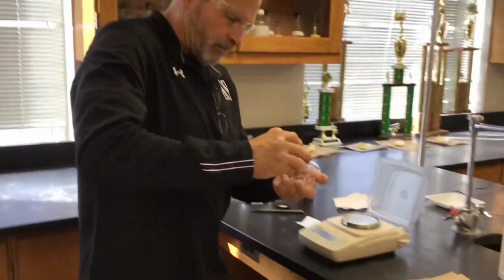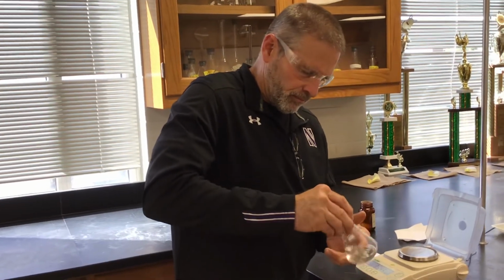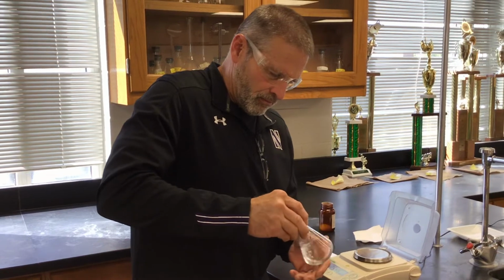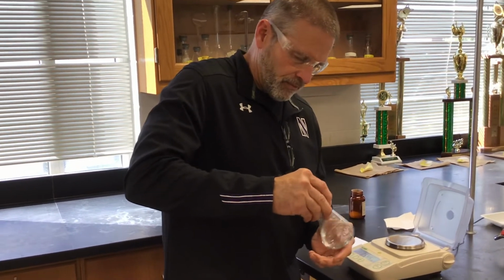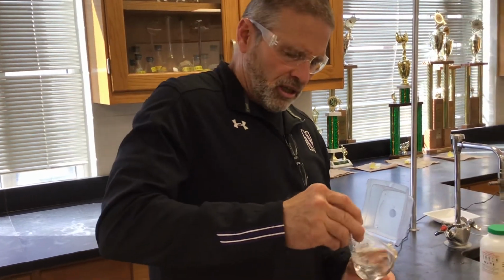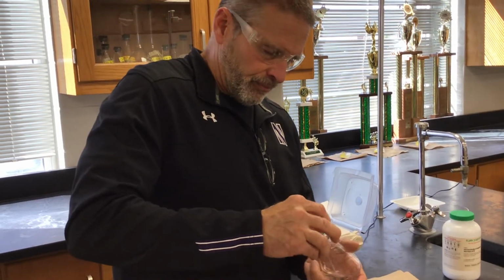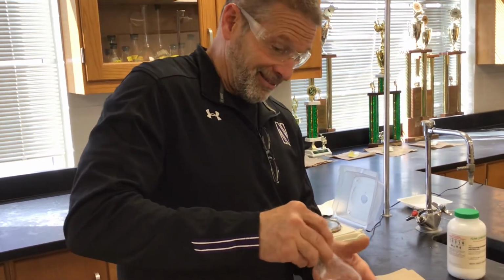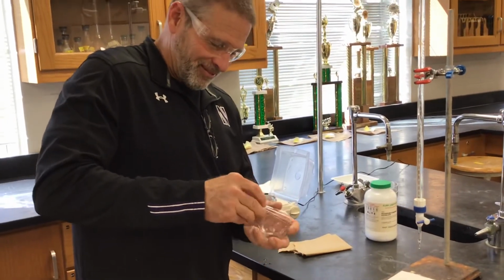So, Mr. Hevel, you and I have already done a fast and sloppy trial of this one, so we have an idea of how much it takes, and we didn't bother putting it on the camera just so it would save time. So we're going to have hopefully 2 good trials that you would use as part of your calculation. Well, if you're doing them, we know they'll be good. Well, I'm glad you have faith.